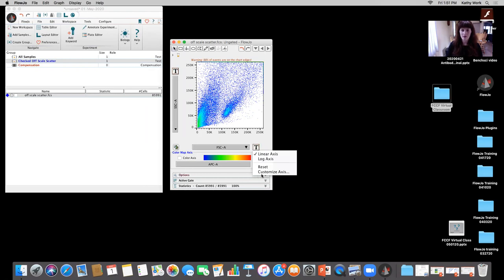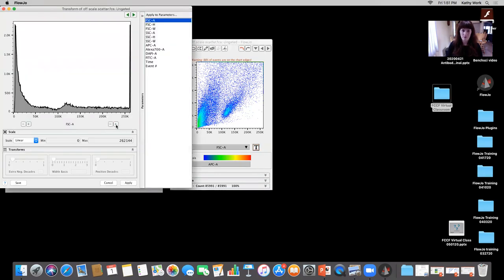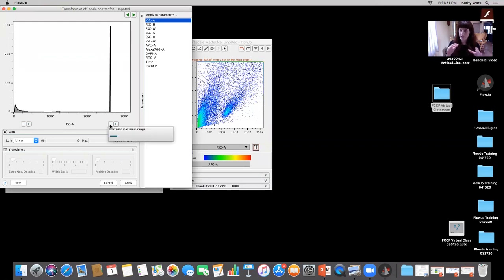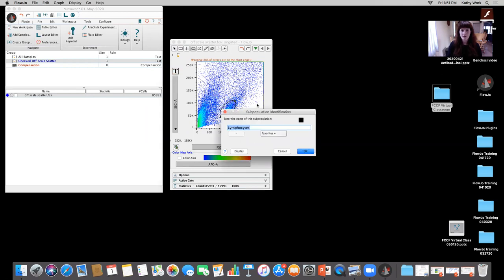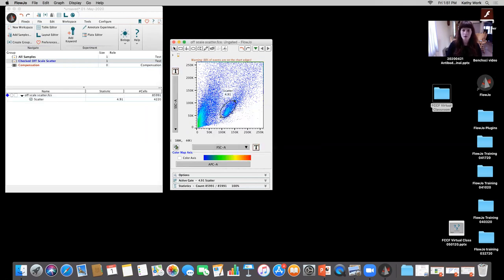So even if I hit that transform button, I customize, I try to add more, that's the max for this detector, 250,000. So I can't go ahead and change the scaling to bring these in like I did with the Cytoflex, okay? And what wound up happening is they said, oh, these are my cells, do a little scatter gate right there, pretty tight. And I'm gonna do this relatively quickly. You can see how much debris there is there.